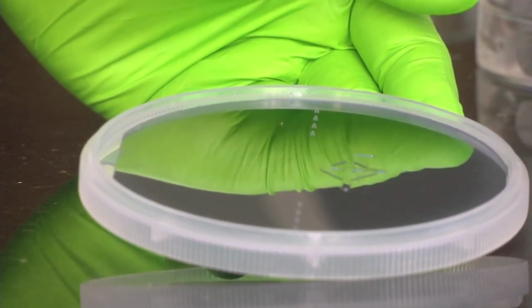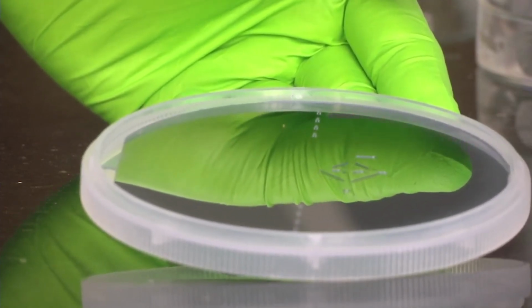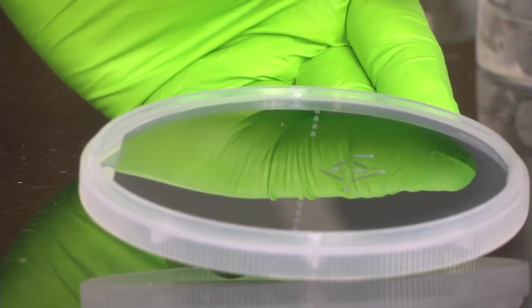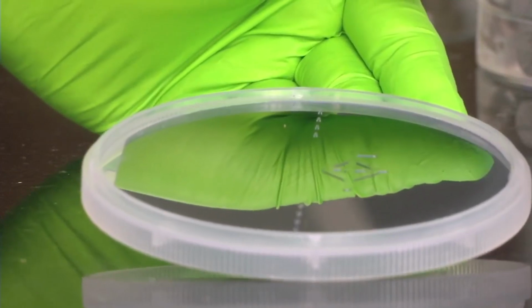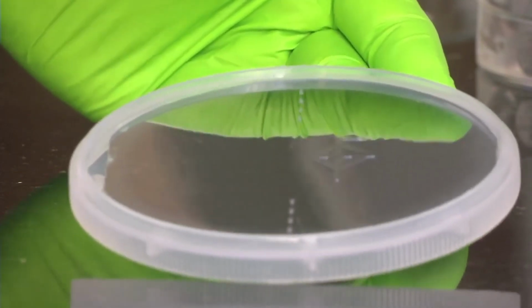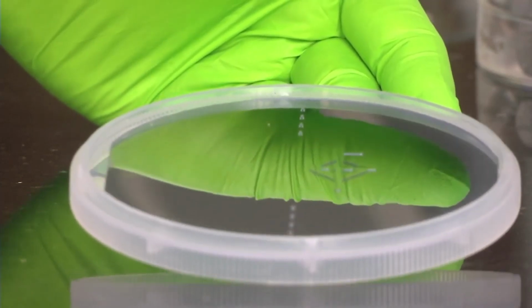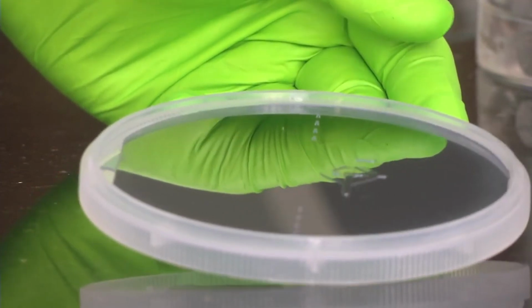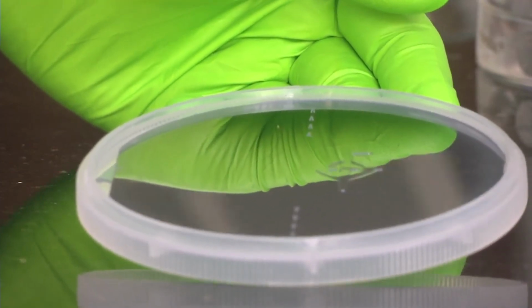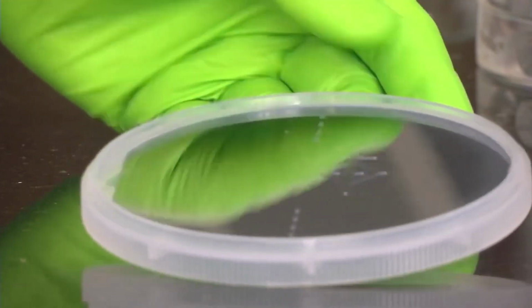The process we use is deep reactive ion etching. I think you would have covered reactive ion etching in the theory, or if not, you will be covering it. So reactive ion etching is used, and it etches out the pattern like this on the silicon wafer surface. Once that is done, we remove the photoresist from the rest of the wafer, and then we have the silicon master mold with us. Once this mold is ready, we are good to go to do PDMS molding.